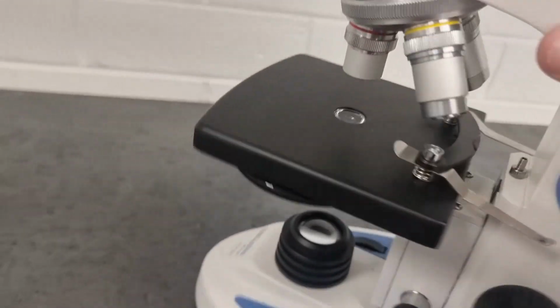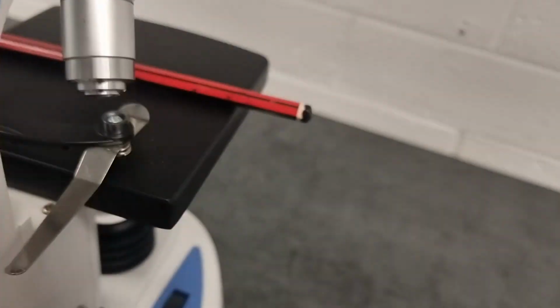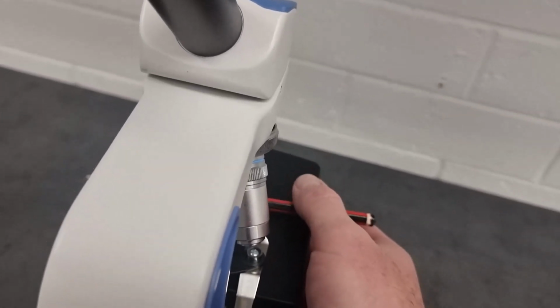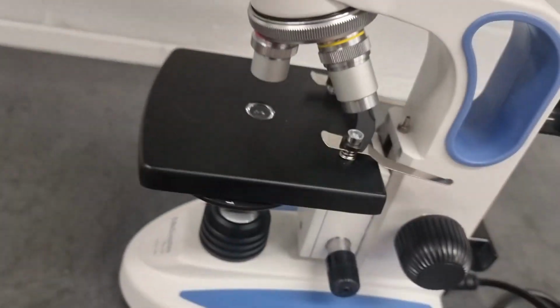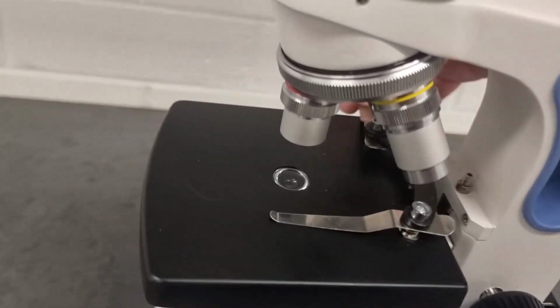And this means that when your specimen slide is on the stage, you can move it around. If it's not actually clipped in place, as you're looking from behind the microscope here, you just use your thumb and you can move it left and right and up and down. So you can move your specimen around the stage until you get the best view. It's a bit tricky to do that if your slide is actually clipped into place. So a common practice is just to throw those out of the way.